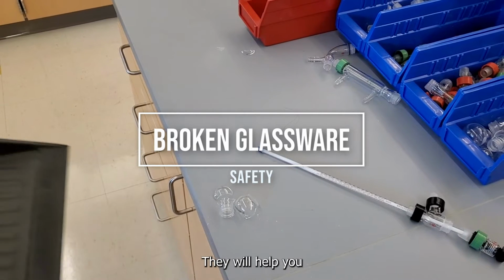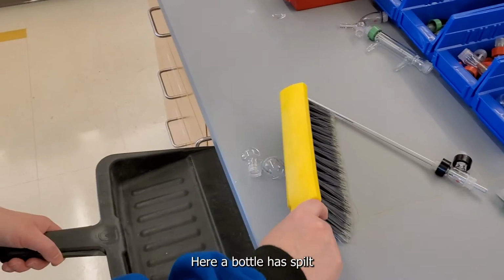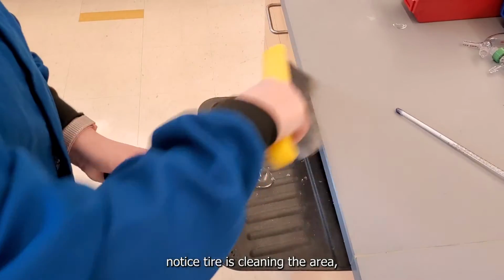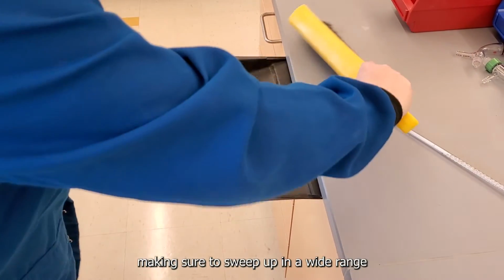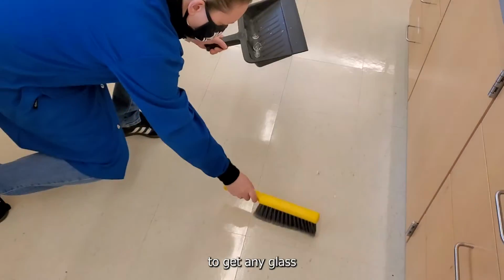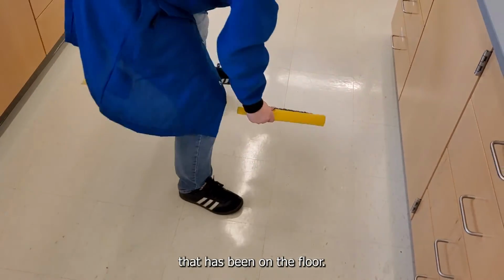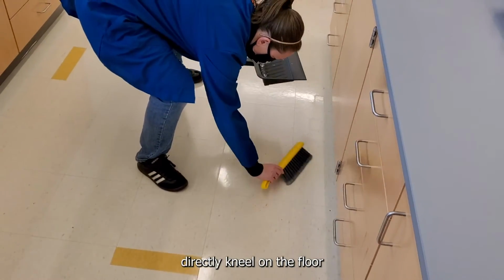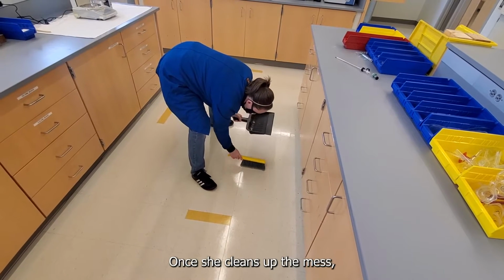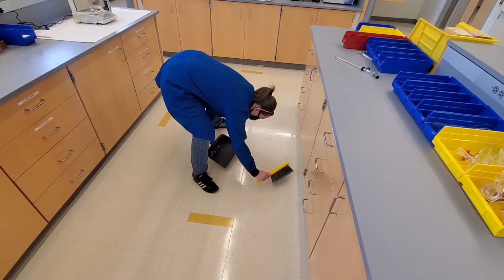If you break any glassware, please let your TA know ASAP. They will help you clean up the situation. Here, a bottle has spilled. Notice, Tara is cleaning the area, making sure to sweep up in a wide range to ensure all glass is picked up. She then goes to the floor to get any glass that has been on the floor. Notice she does not directly kneel on the floor to prevent any glass from cutting into her clothes. Once she cleans up the mess, she will dispose of it.